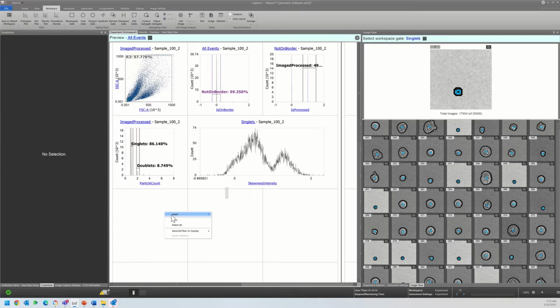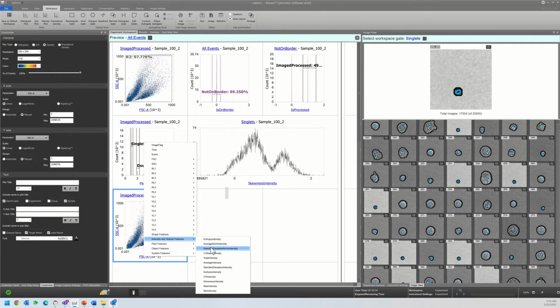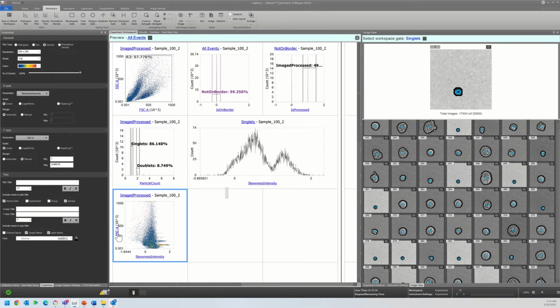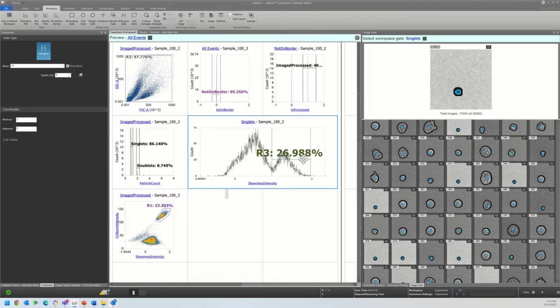However, one of the things that I can do is use a parameter that gives me really good resolution and plot that against one of these parameters where I'm not seeing the same clear delineation. So coming in here, skewness and CV norm intensity. See, now I'm starting to get this separation. And one of the things that we know about our sample is that the beads are probably going to be more highly skewed than the cells because they are so much darker, so the pixels are so much less intense, less bright. So looking here, let's look at R3.